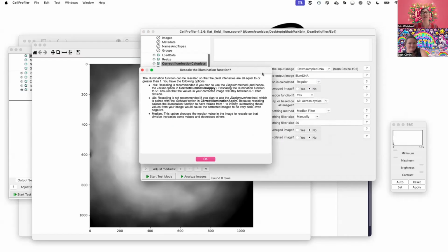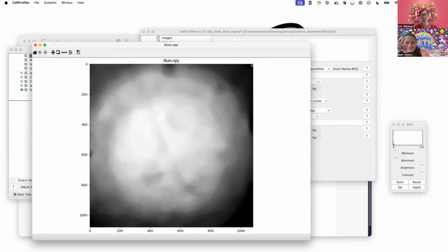This has to do with setting the values of the function that we create. When we apply it, which I will get back to, it's hard to explain all the pieces without jumping ahead. As we put it out here, the darkest of the dark is set at an intensity of 1, and the brightest of the bright is 1.8, or 1.8 fold brighter. Then when we apply this image in a downstream pipeline, we are dividing that image by this. So the darkest regions are not touched, but we are scaling down the brightest regions so that they are appropriately scaled.